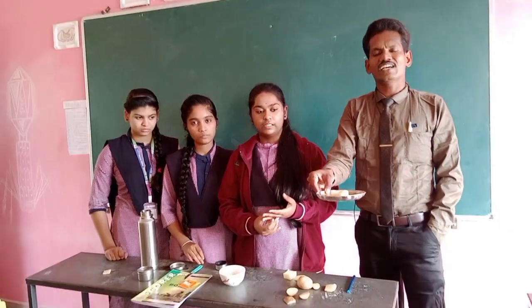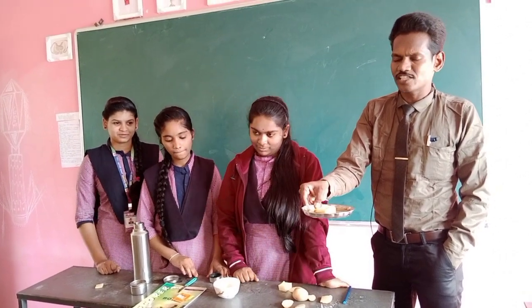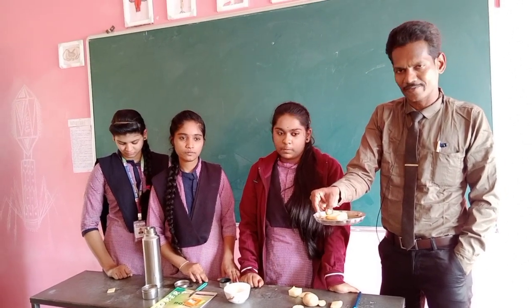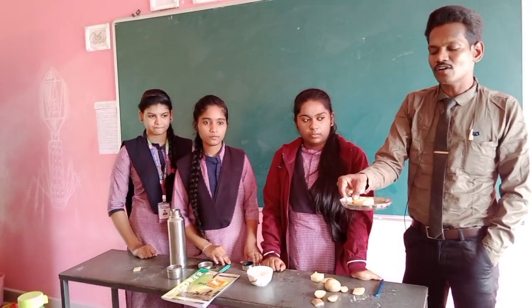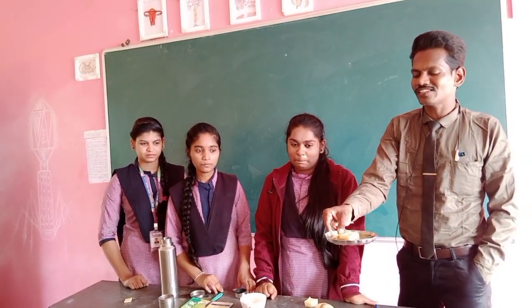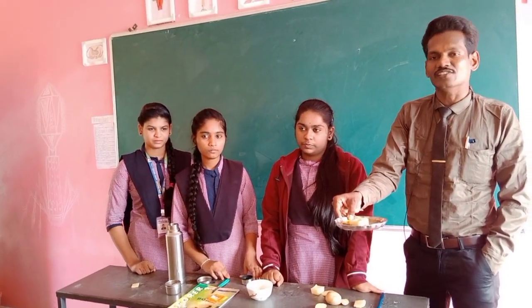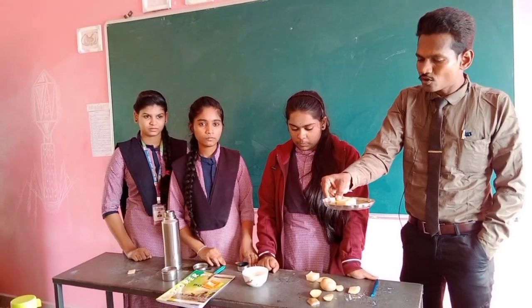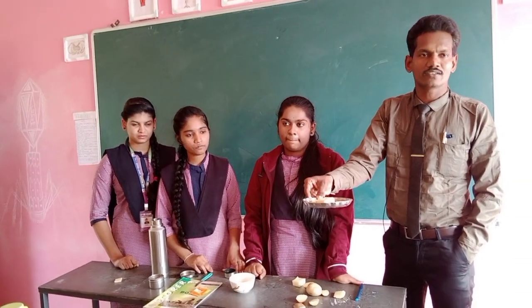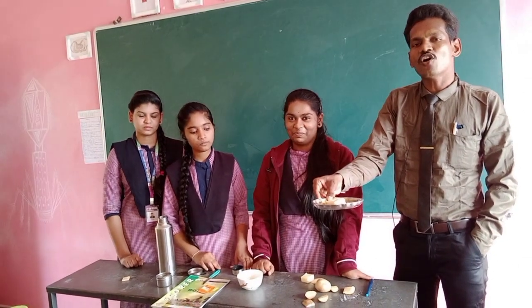So here in this saucer, lower concentrated solution has been taken. We know that in lower concentrated solution the water molecule percentage is higher. In the pit of that potato, higher concentrated solution is taken, that is the sugar solution. If we leave this setup for half an hour up to 1 hour, endosmosis occurs. The water molecules from the lower concentrated solution enter into the sugar solution. So water molecules are entering from lower to higher concentration. This is known as endosmosis.